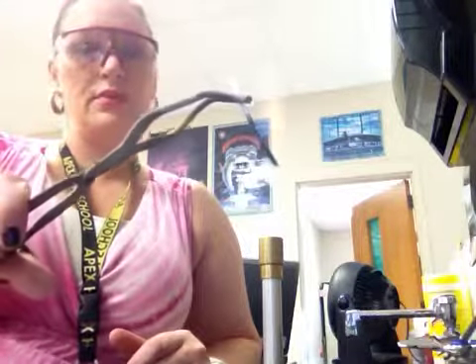And then I'm going to put it in the flame. It takes a minute for it to heat up, and it's burning a bright white color. I notice now that the product I have is sort of ashy and it's now a gray color, so there's definitely been a color change. It also gave off a lot of heat. So when heat is given off and there's a color change, those are two pretty good indicators that a chemical reaction has occurred. I want to make sure that I record those as indicators on my data sheet.